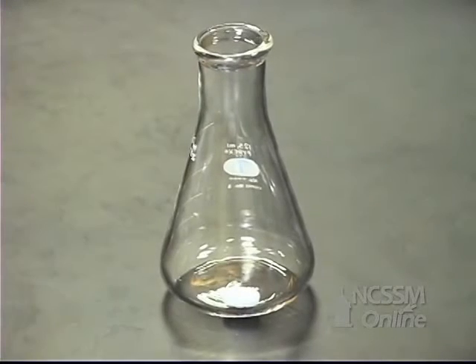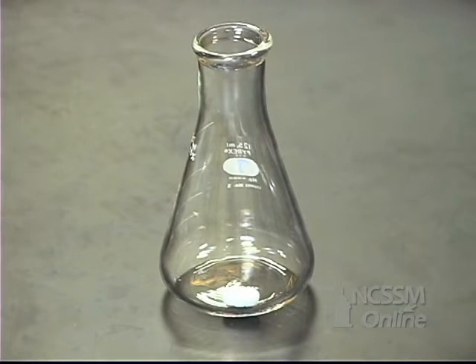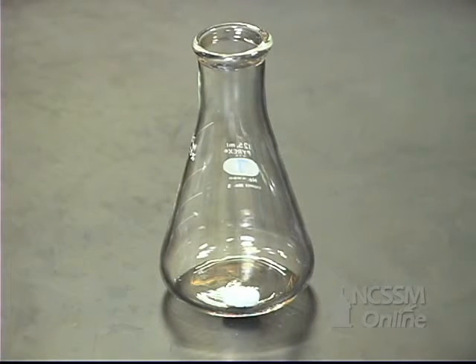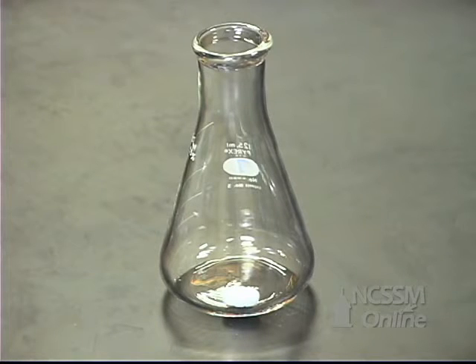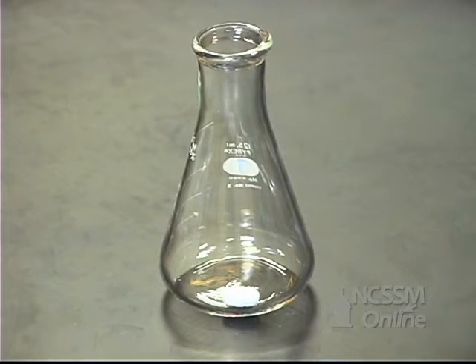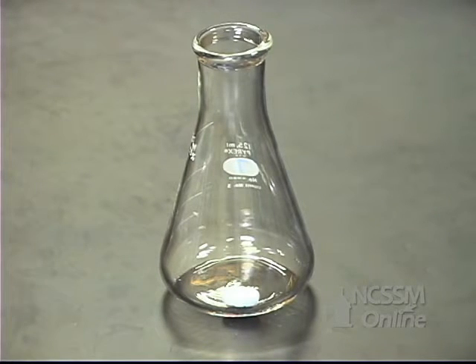We're going to determine the KSP of calcium hydroxide by titration technique. We're going to pipette 25 mL of a saturated solution of calcium hydroxide into the flask.